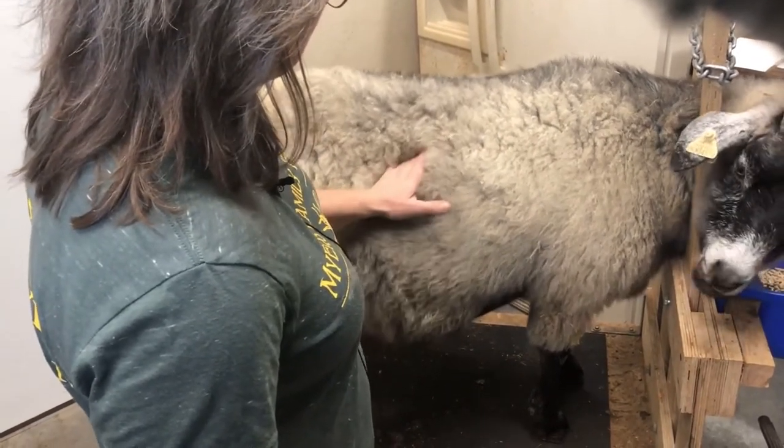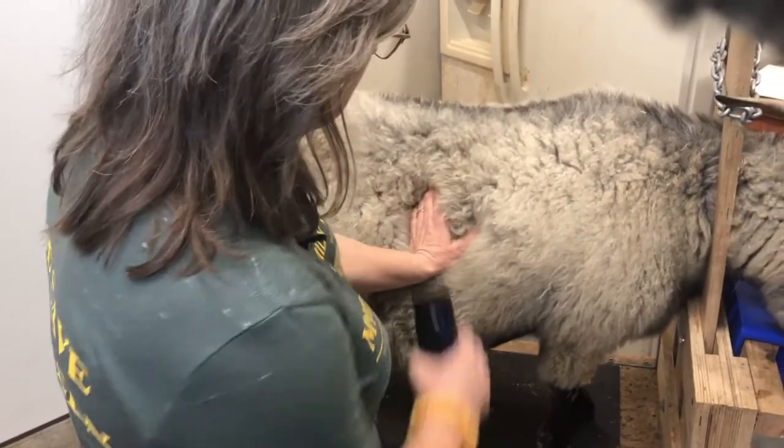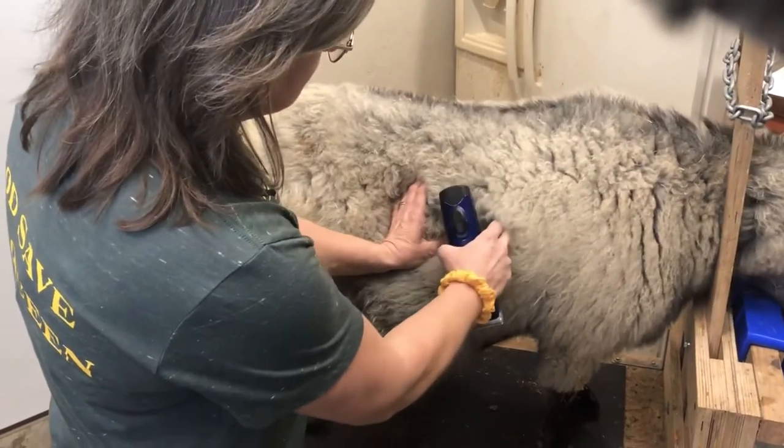You're going to put your fingers in that little notch and let your thumb fall kind of where it would naturally fall. And this is the area that we're going to be collecting the sample from.